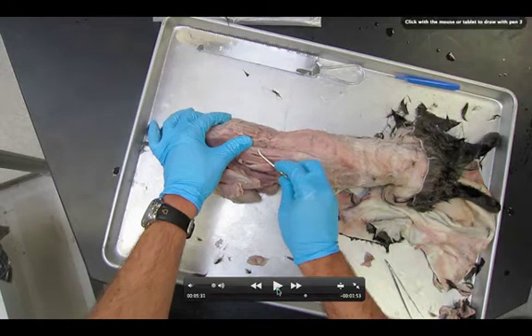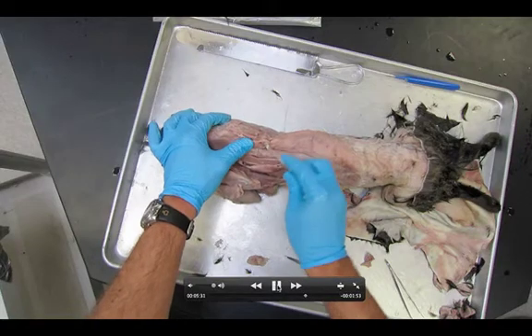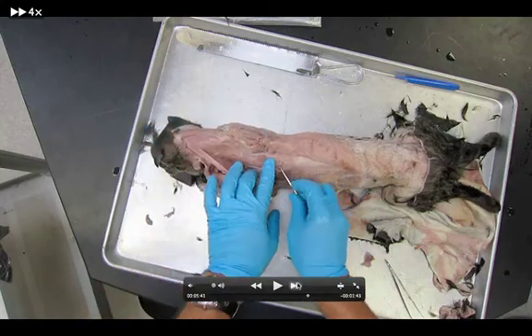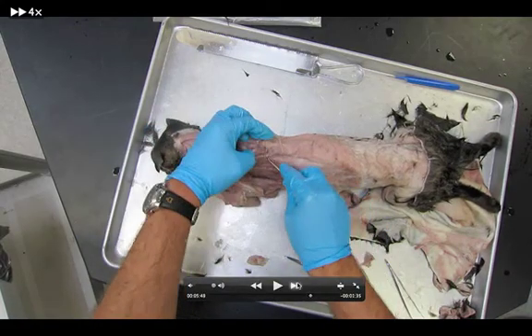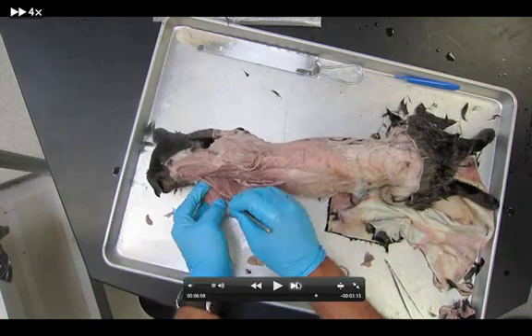You're just really outlining the edges so you can see them well. Let's make sure we can see how I've done this. There is a muscle here, and a muscle here, and the one that I peeled down, and another muscle underneath. So: iliocostalis is this one down here, serratus dorsalis, longissimus dorsi — it's very long — and spinalis dorsi. The splenius is up on the left side where my hand is covering. I'm just clearing stuff out and pointing them all out.